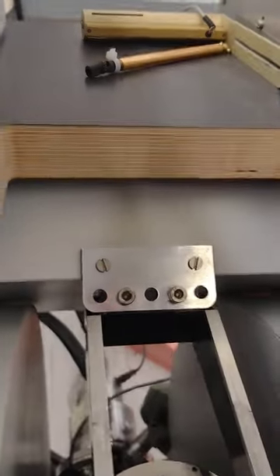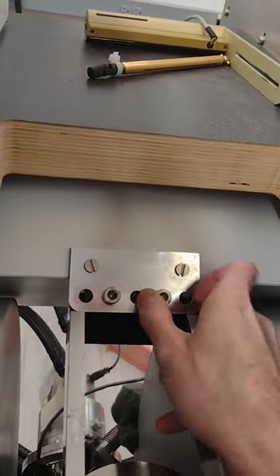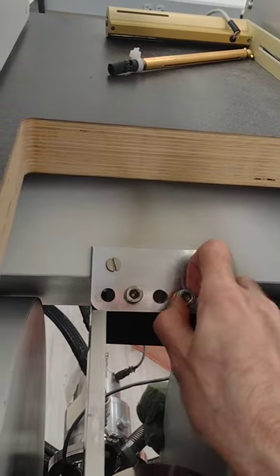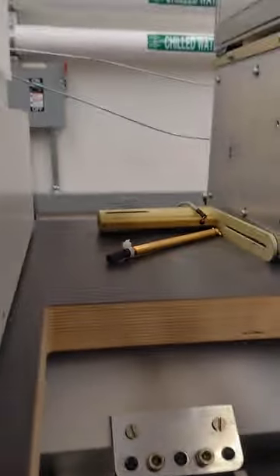Alright, and then you can support it and have someone hand thread it, or you can do it with your two hands. I only got one hand right now.